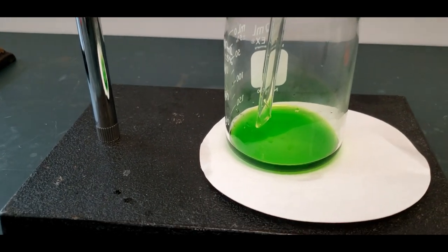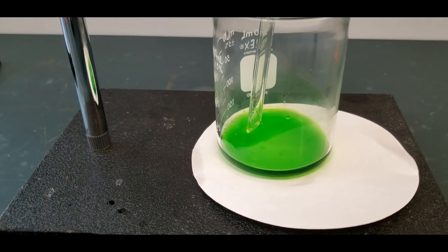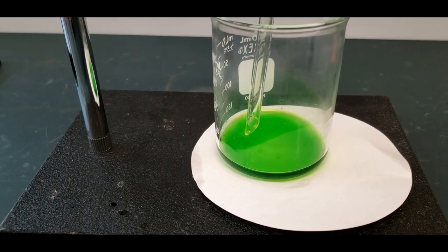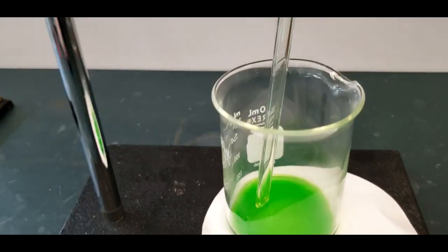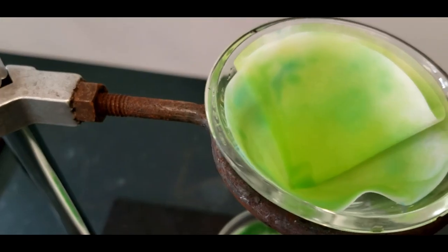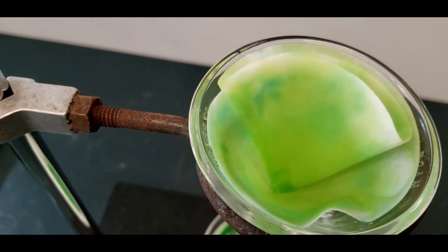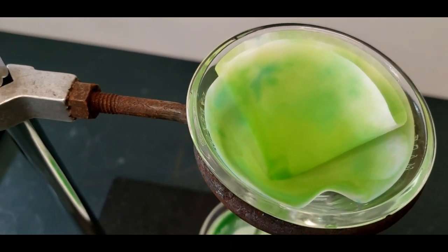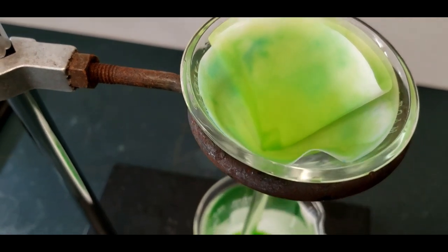Here's our solution. This is our copper two chloride solution for the observations you have to make. And here is the filter paper. Still a little green. Some of the copper ion is still in there. So we're going to have to wash that through. That's going to be the next thing that we do.